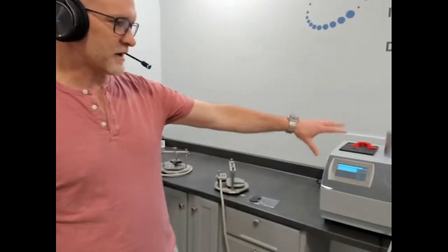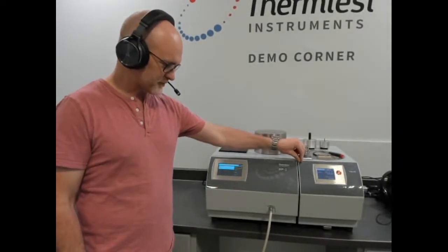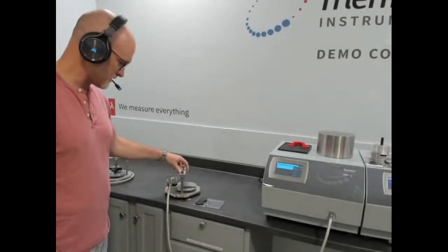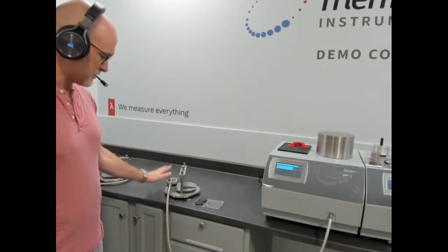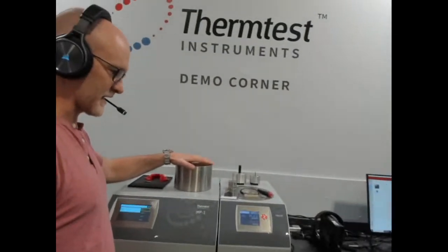So we're going to show a sample setup using the transient plane source inside the temperature platform. Talk about that. And then on the MP1, we'll talk about a symmetric 2-sided setup on the bench so you have an understanding of both. So let's move over. Maybe we bring the camera over.